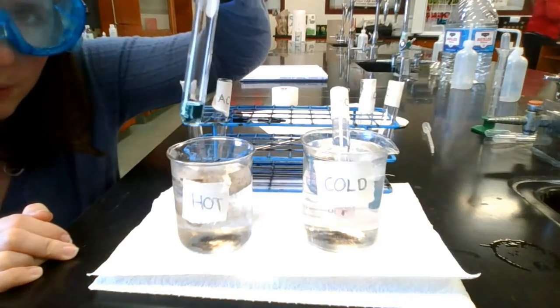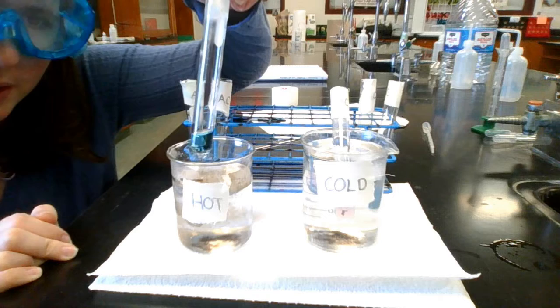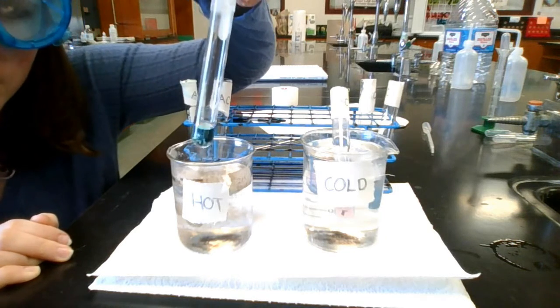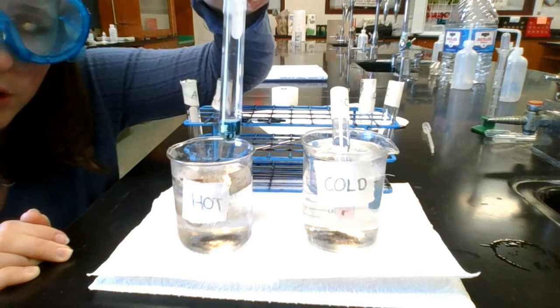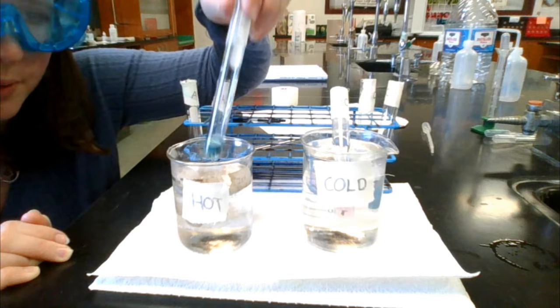You can see that it is now blue. So the pink color disappeared after about 5 seconds. It turned clear. It was clear for maybe 20 seconds, and then it started to turn a dark blue again. So as you can see here, the HCl with the cobalt chloride, it is this red color, this pink color, instead of what it originally was when we first added the HCl, which was this bluish color.